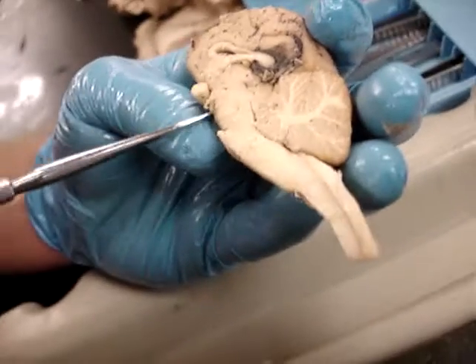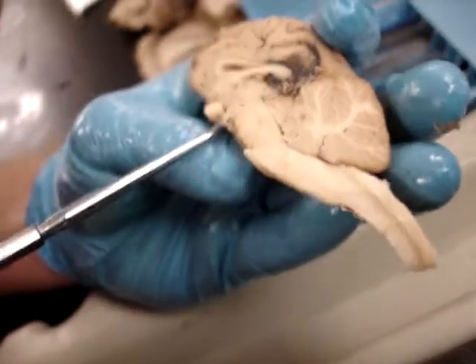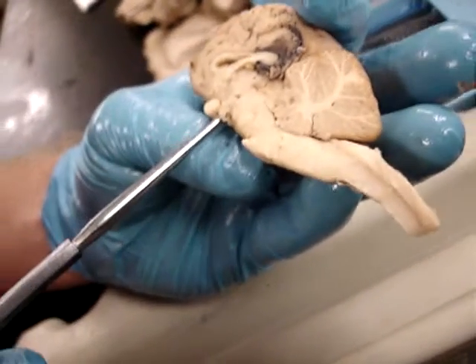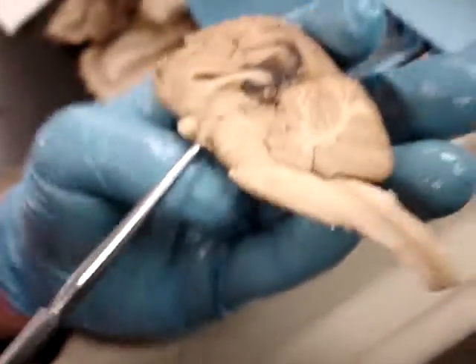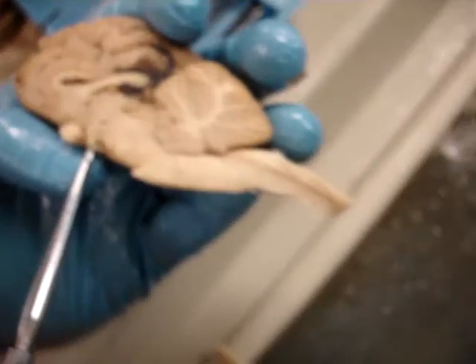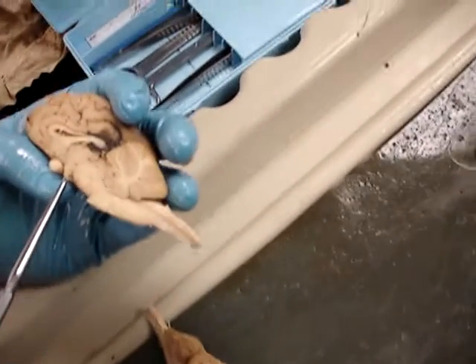Right here going up is the interventricular foramen — or is it still called interventricular in this context?